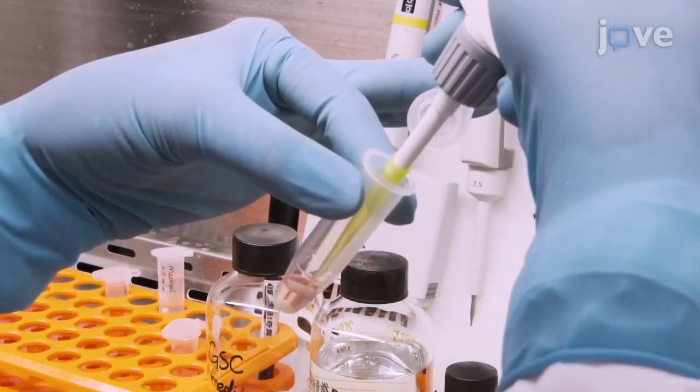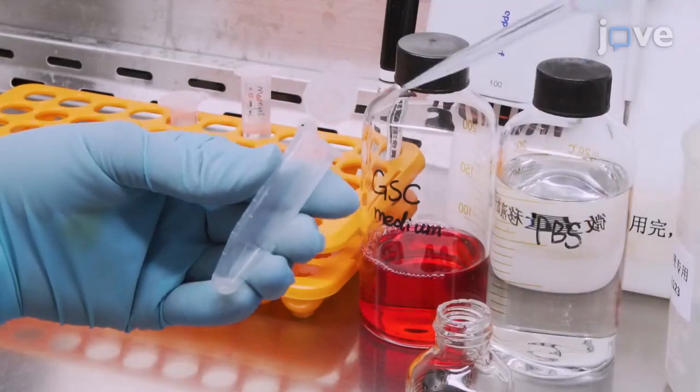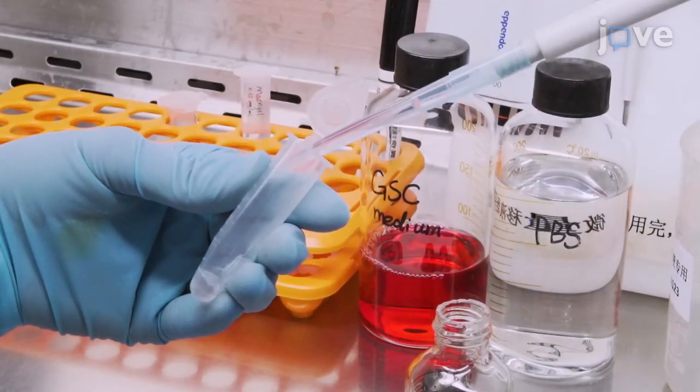After removing the supernatant, digest the cells with Accutase for 4 minutes at 37 degrees Celsius.